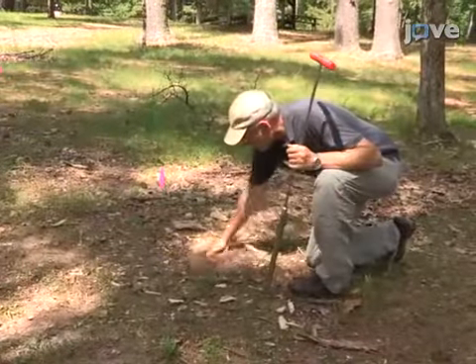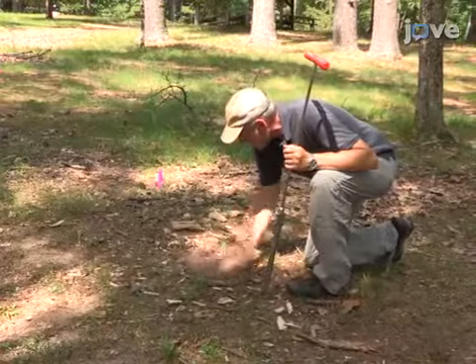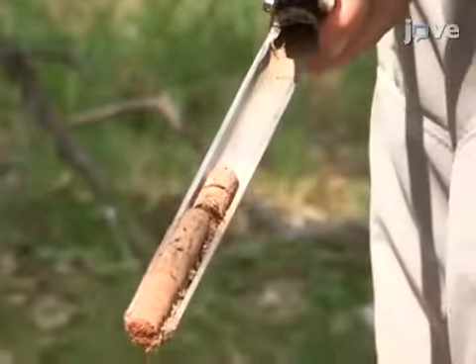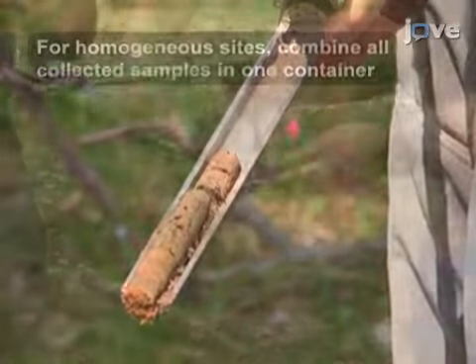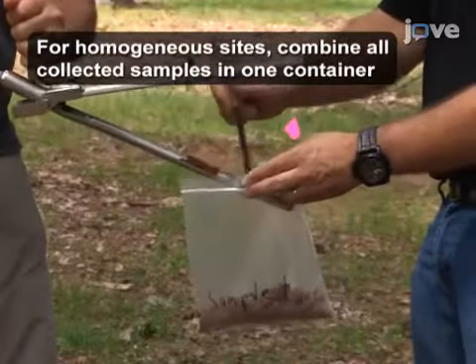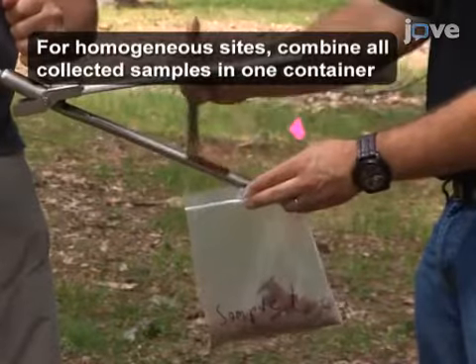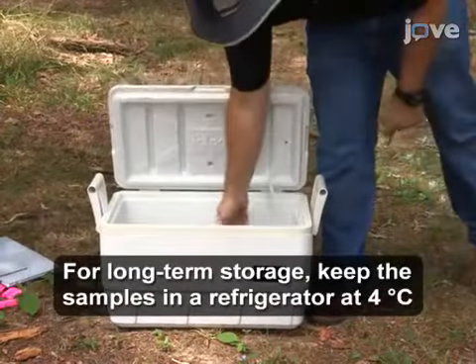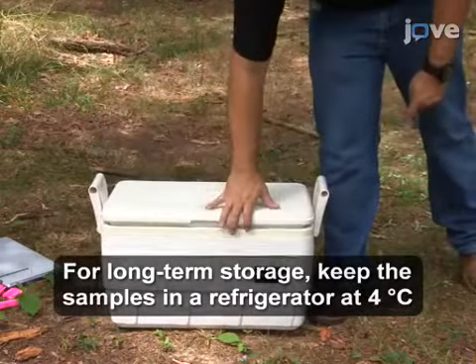Clear organic matter from the soil surface at the sample points. Using an auger, collect each soil sample. For each transect of the grid, mix the samples in a single container. Place each composite sample in a cooler with ice packs immediately after collection.